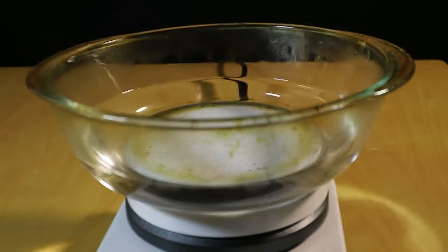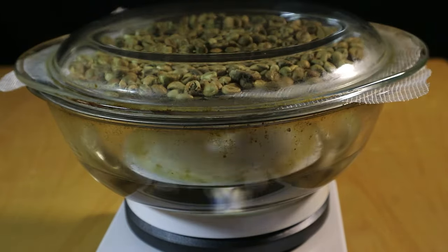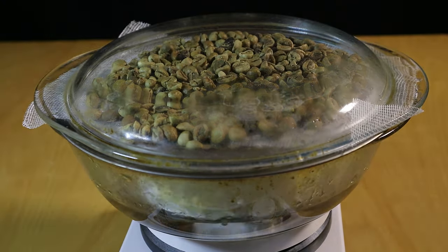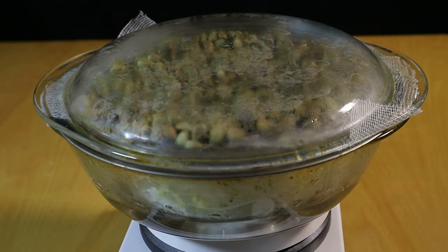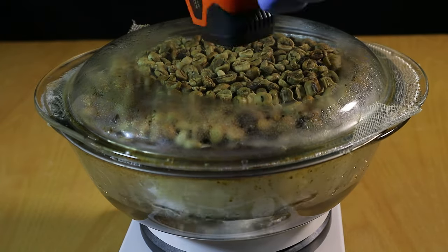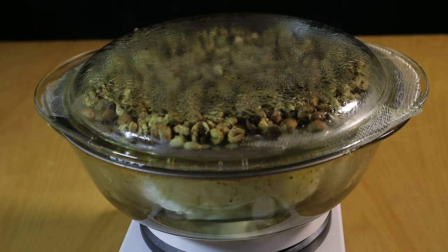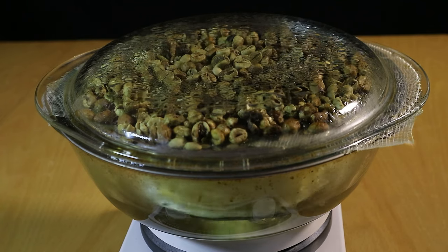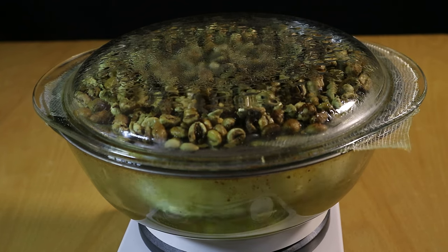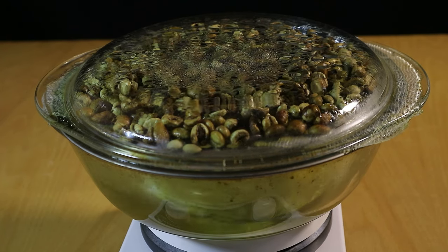We are going for a direct solvent extraction method using ethyl acetate. In coffee beans, the caffeine is apparently bound in a complex with another constituent — namely the chlorogenic acid. We can make the caffeine available for extraction by separating it from the complex and migrating it towards the surface of the bean. To do this, we need to increase the moisture levels of the beans. We steam the beans to open up their pores so that caffeine can escape.